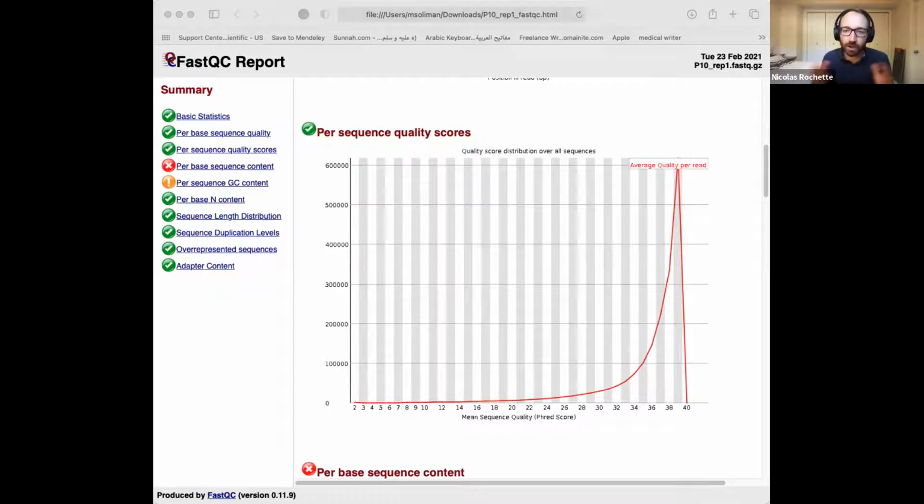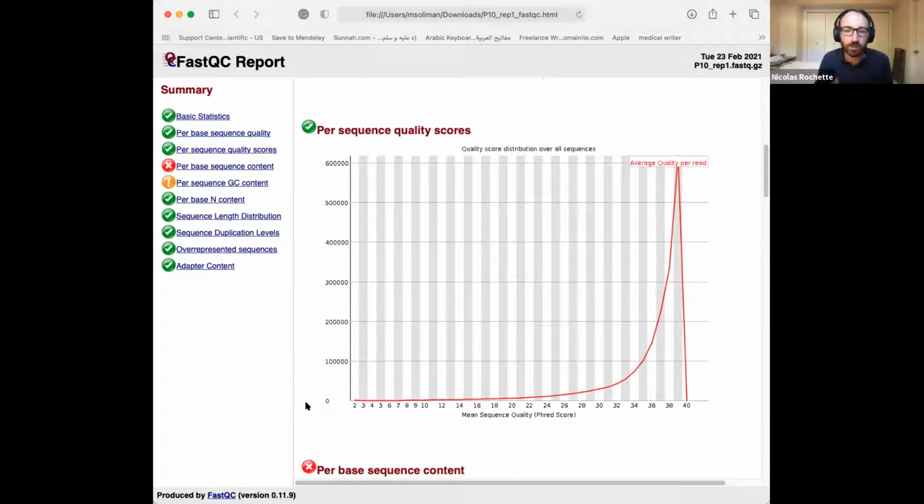And if there are big differences between our samples, that probably suggests that something went wrong somewhere in the experiment. So maybe one sample is very different from all the others for no reason. That suggests that this is a technical outlier. And sometimes it's not very clear. Just looking at the FastQC files is not a very powerful way to detect that this or that artifact has happened.